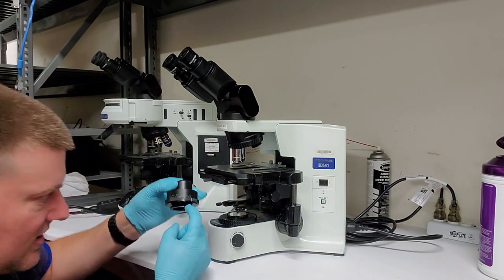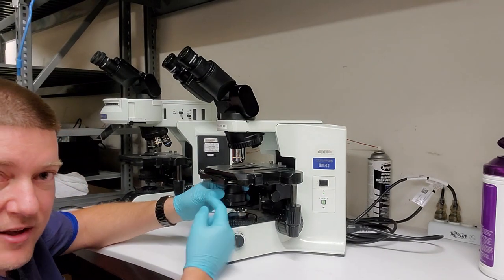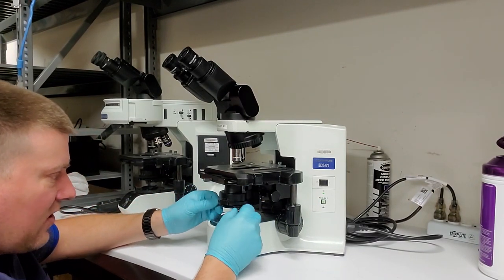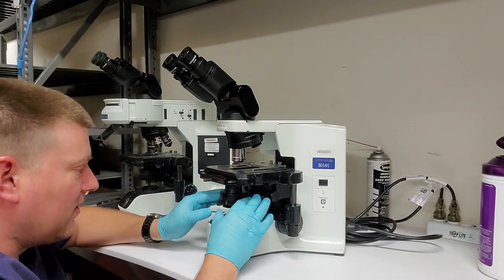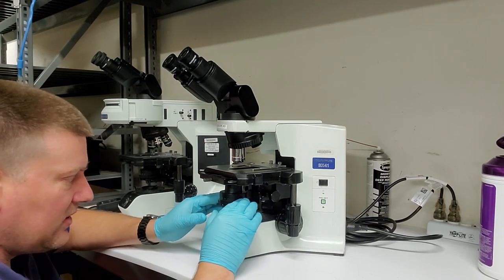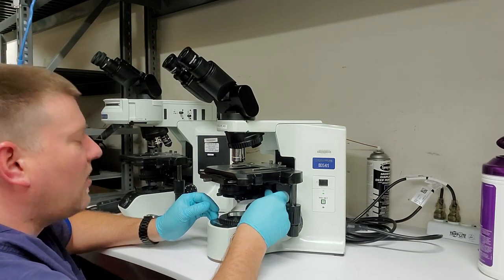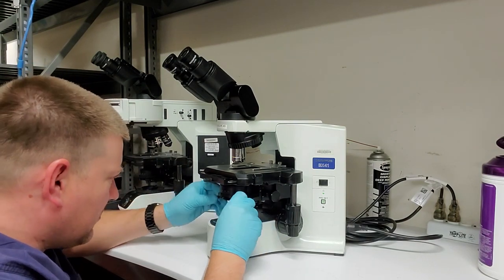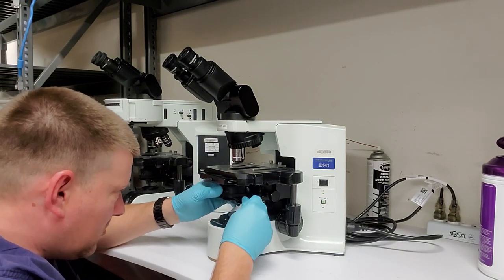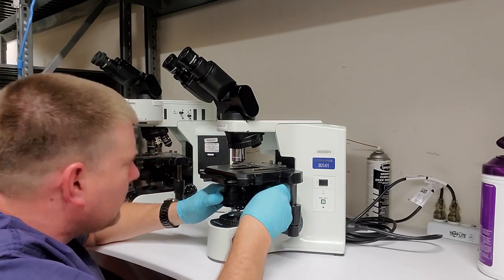Okay, and then you're gonna sit this unit back on its cradle and make sure that the scale is facing out because you don't want the doctor to look at the side for their scale because they have their settings that they remember. Okay? Make sure that your iris moves from one range all the way to the opposite side. And then we're gonna go ahead and raise the condenser all the way up. Let's put this guy all the way back where it belongs. There we go.